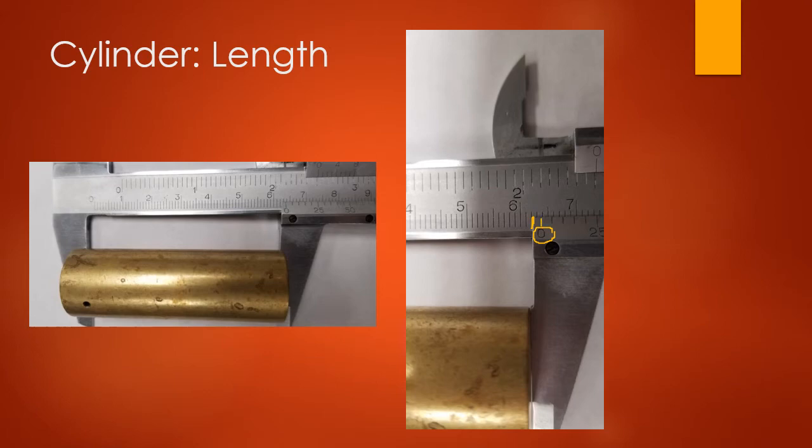So the measurement, the 6 centimeter mark is this long mark right here. So we have 6.1, 6.2, 6.3. So it's almost to the 6.4, but not quite.